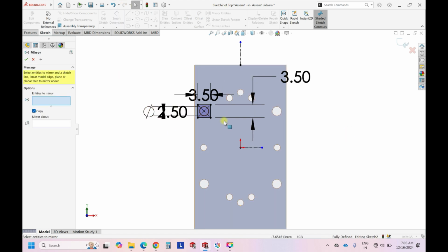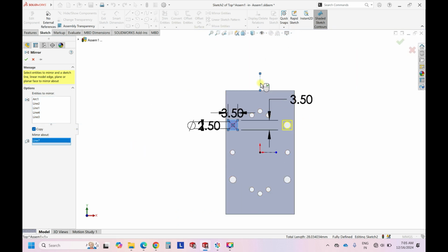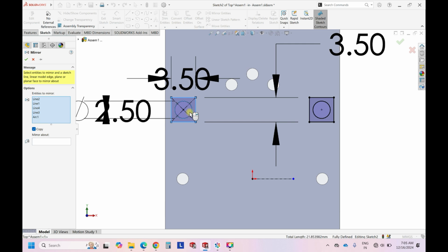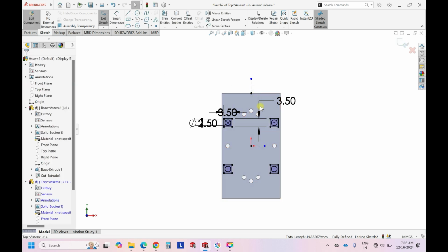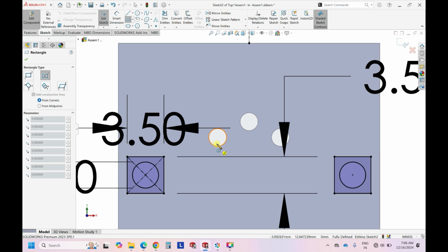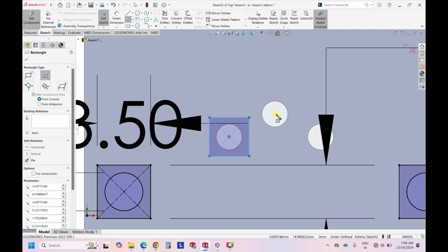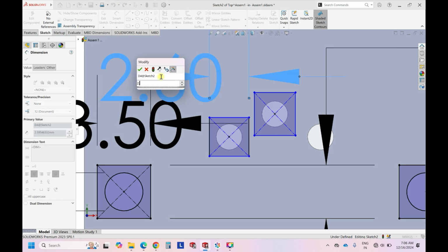We can use the center line options. Right, so we can mirror this, copy about this. In a similar way, mirror this and this, both of these. In the same way, you can create another circle, and for this, 2.7.